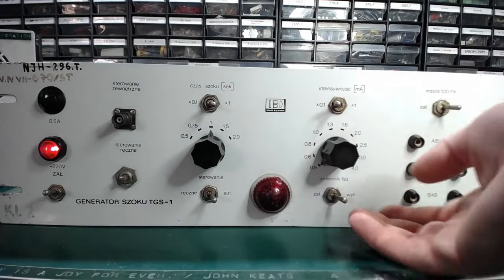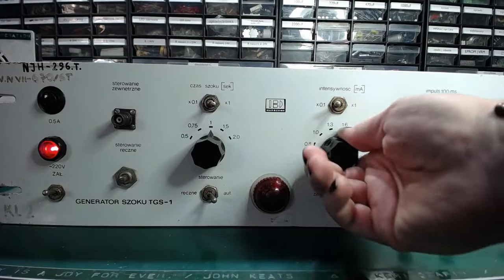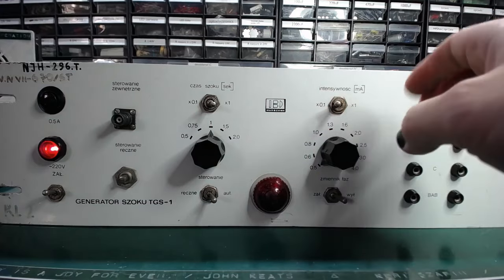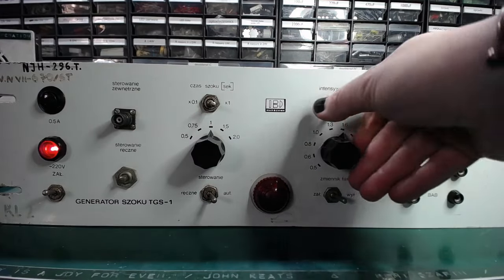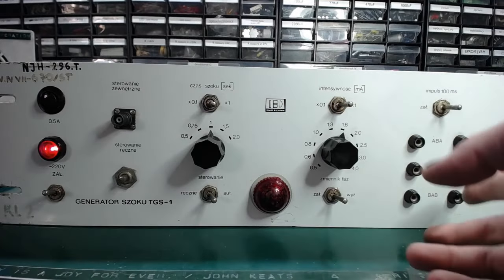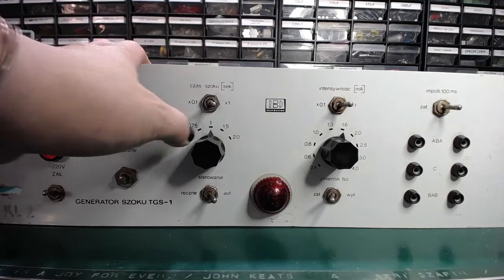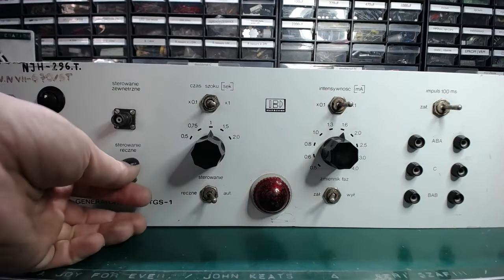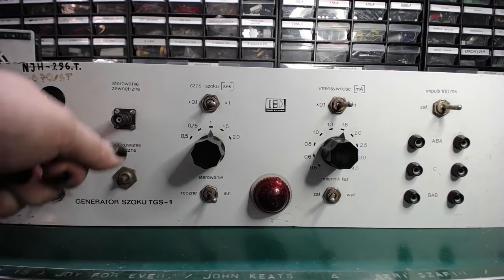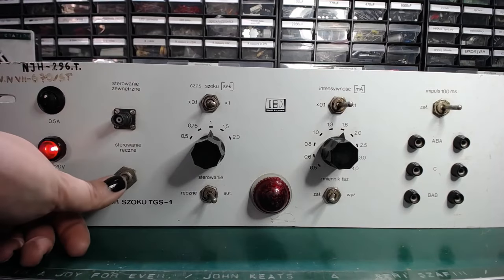This switch, together with the dial here, sets the intensity of the shock. That is basically the current, times 0.1 and times 1. And this turns on the motor if the device is in the shocking mode or the shock duration is short.